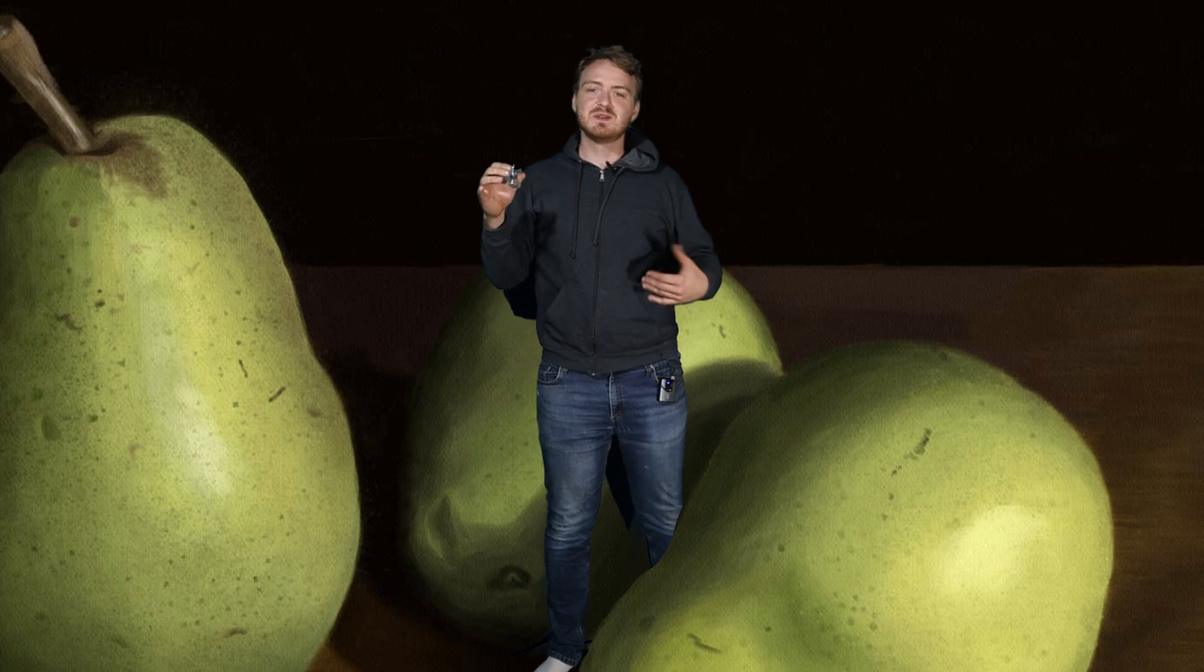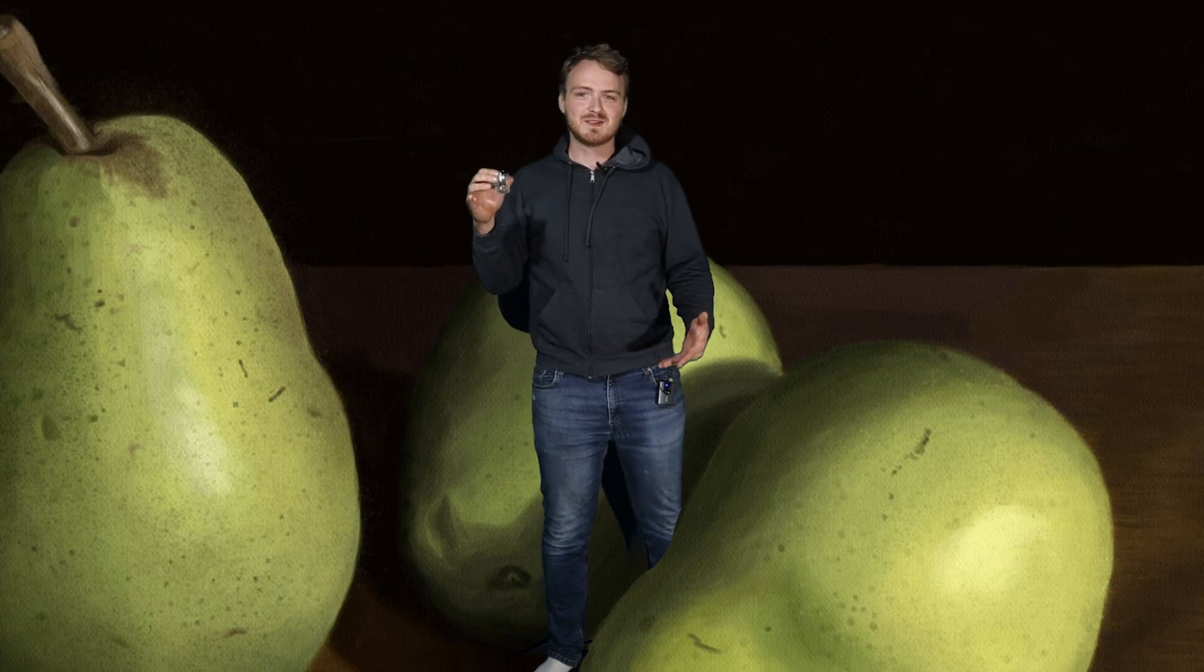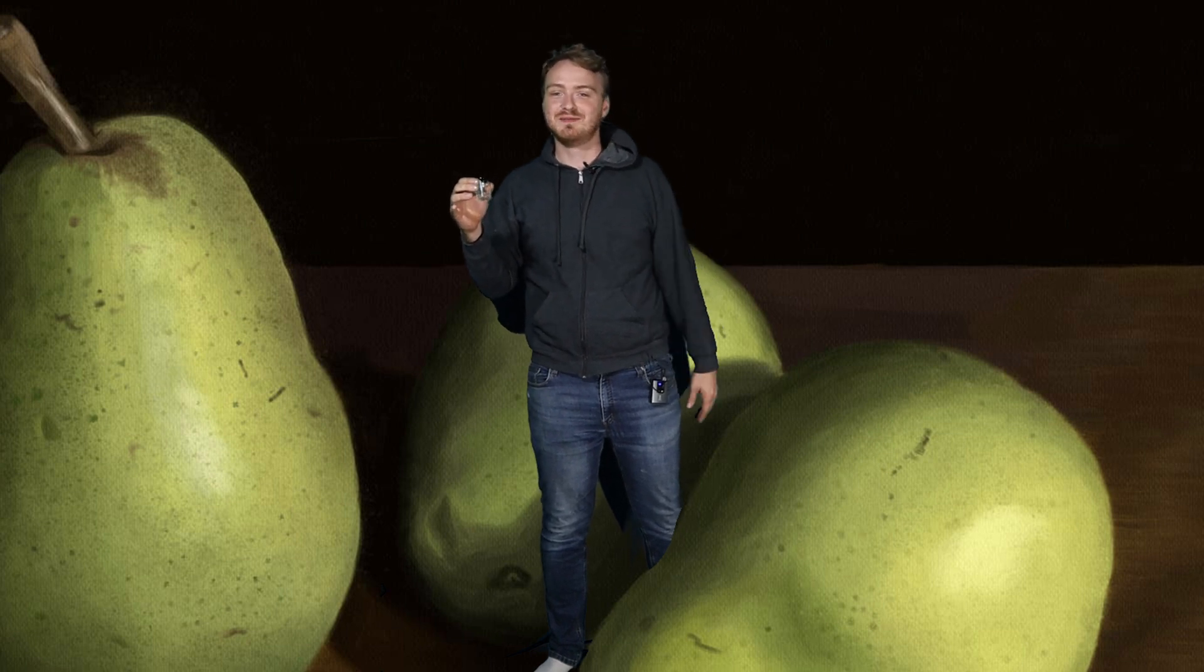Yeah, the thing is, when I was making this, I'm like, what does a pear smell like? This is what a pear smells like. It smells like a pear. I guess it does have a smell after all.